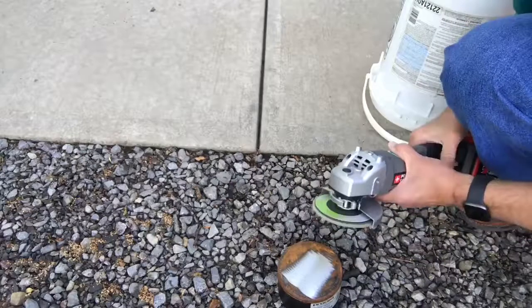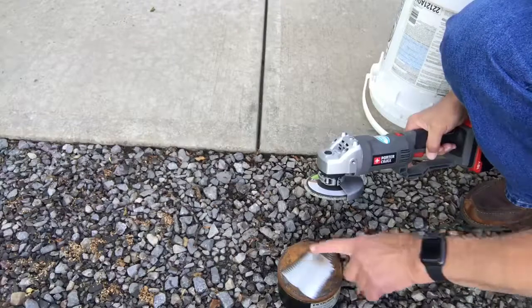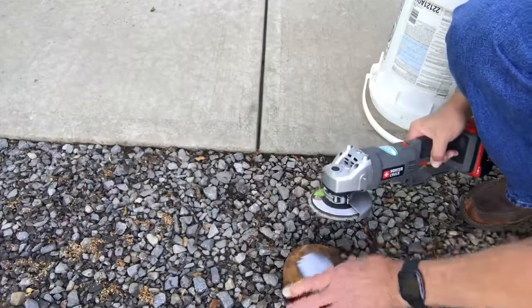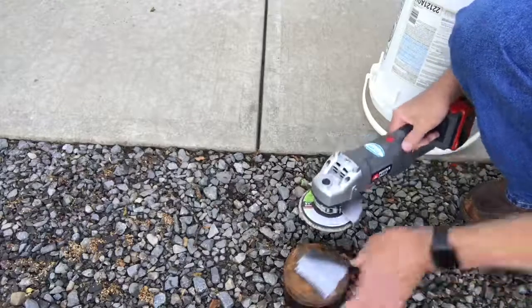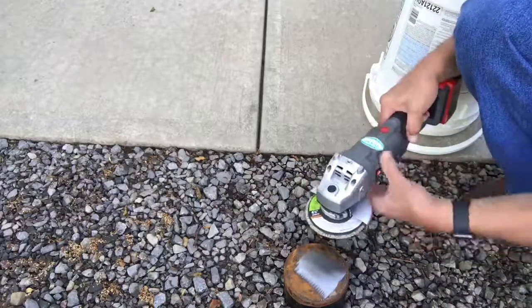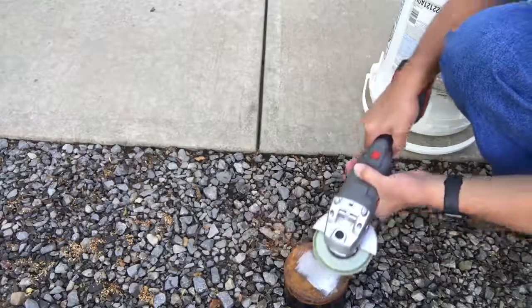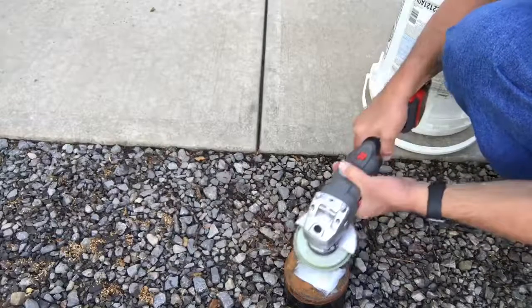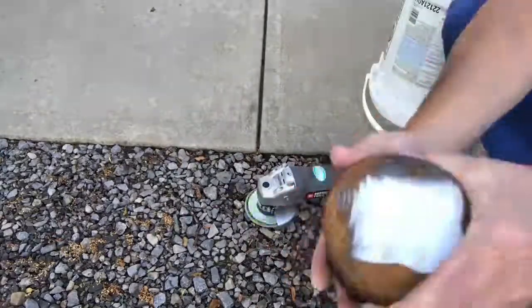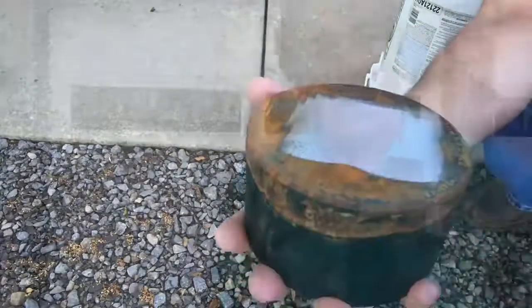When you're preparing the surface, you'll notice you get a tendency of lines that go in line with the way the abrasive is going. So it's important to do a little crosshatch pattern just to even things out and make sure you try and eliminate any waviness that's going to happen there. And there you go. Nice surface ready for hardness testing.